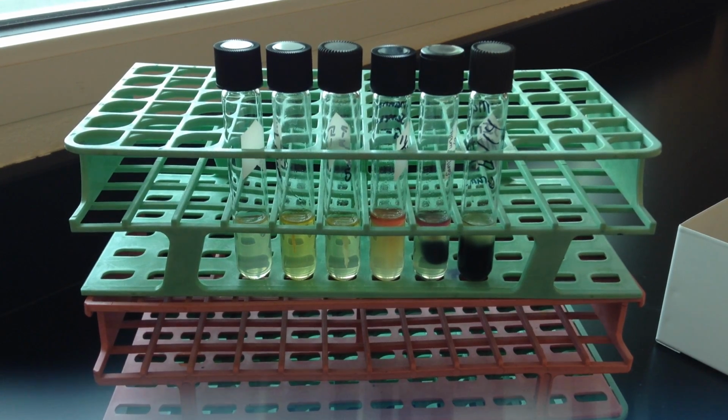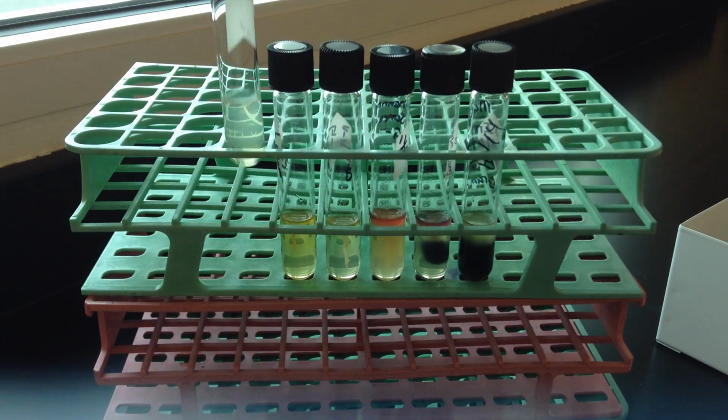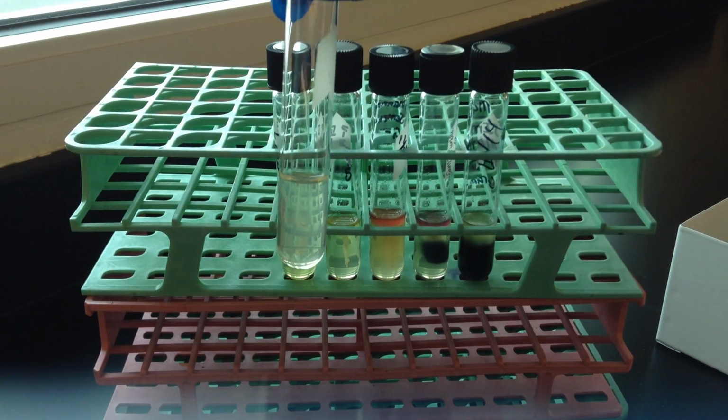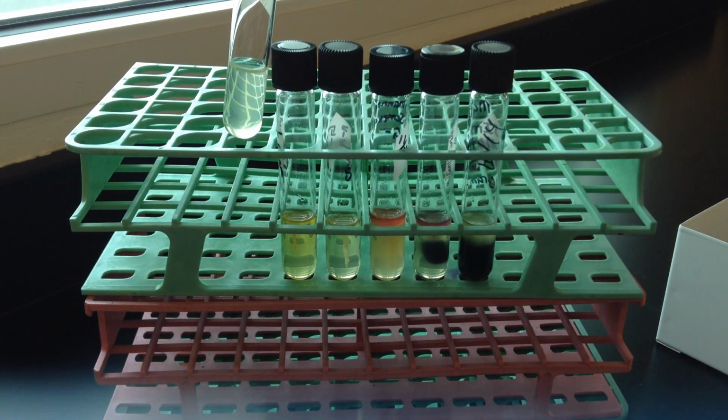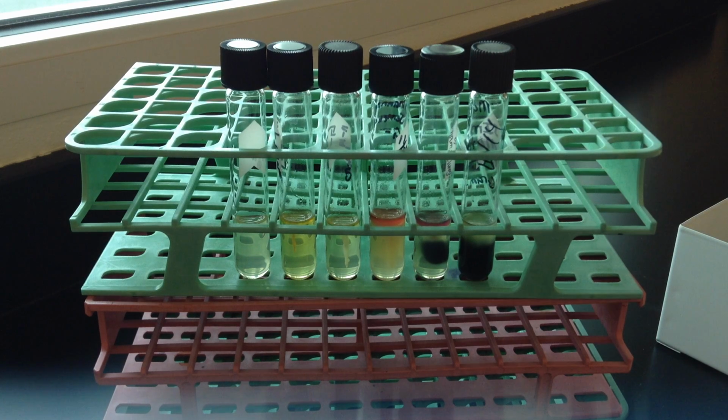This video serves to outline the sulfur, indole, and motility test, or what we call a SIM test. And SIM is a semi-solid deep, as shown here. I'll pull this one up on the left. So fairly soft but solid agar, and of course that requires a stab in order to inoculate the medium. So the SIM stands for sulfur production, indole production, and then the evidence of motility.